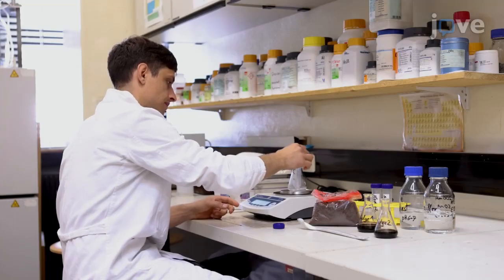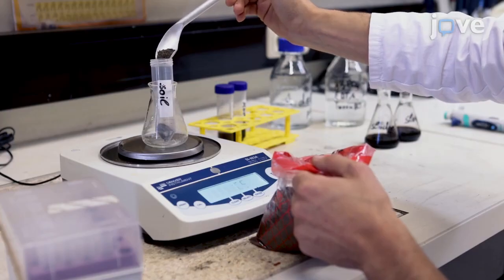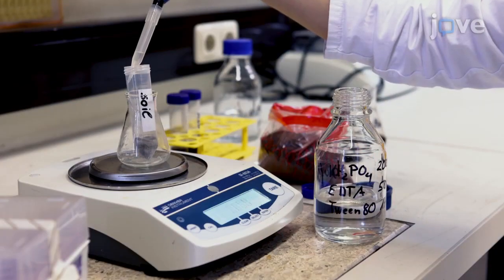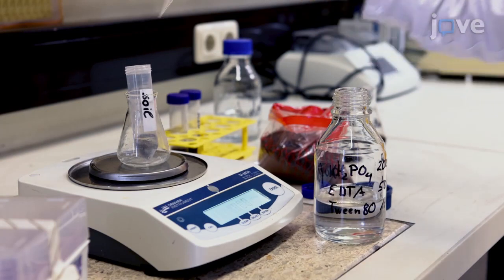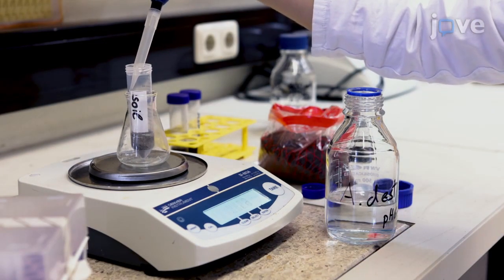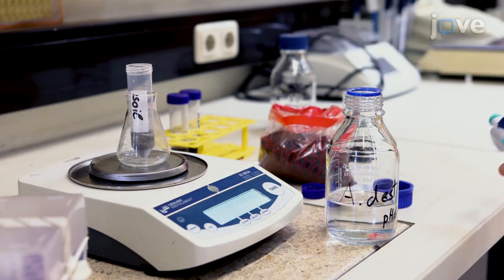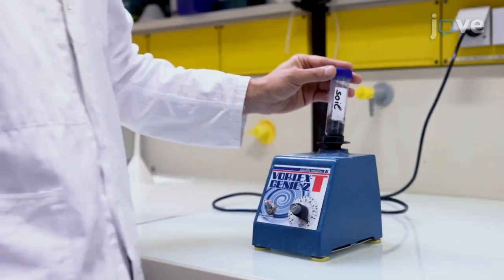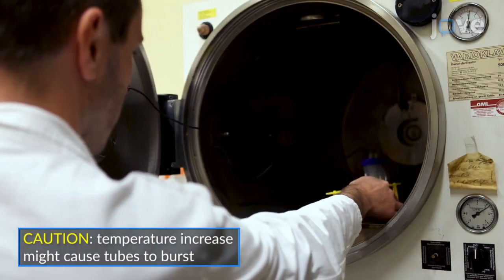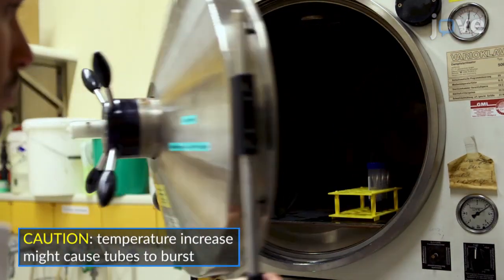To begin with sample lysis, place 5 grams of the sample in a 50 ml conical tube. Then add 5 ml of 2 times lysis buffer to the samples and bring the volume to 10 ml with distilled water to reach a final concentration of 0.5 grams per milliliter. Vortex the diluted samples for 20 seconds, followed by autoclaving for 30 minutes at 121 degrees Celsius.